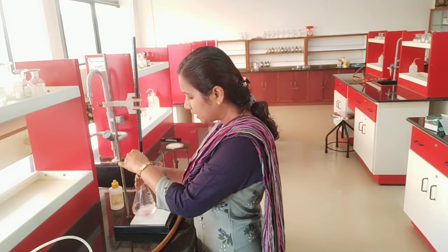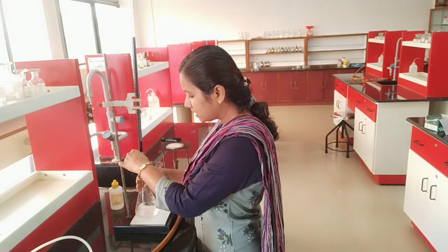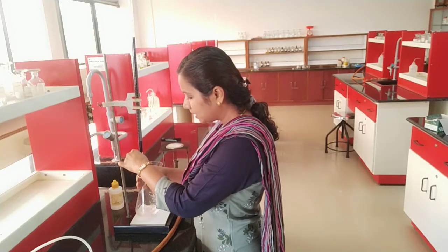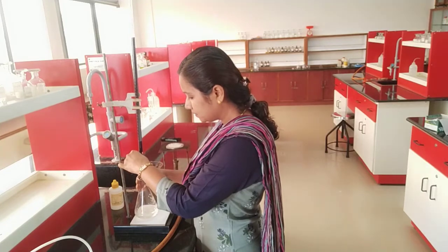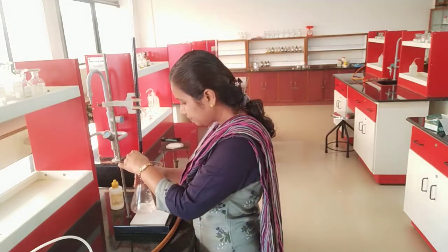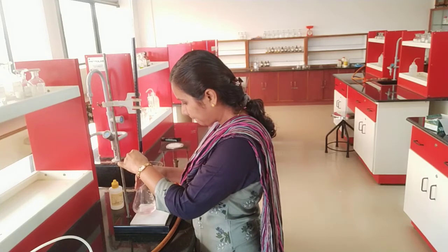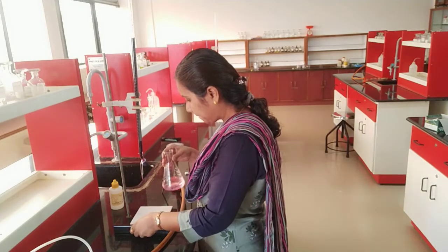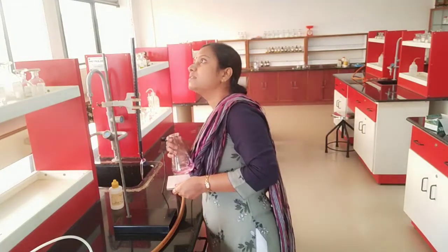Actually this is my 4th attempt because in the first two experiments there was extra KMnO4 added, so the color was very dark. But the end point is appearance of pale permanent pink color. I have changed my burette. The reading is now 16.5, and it is 16.7.